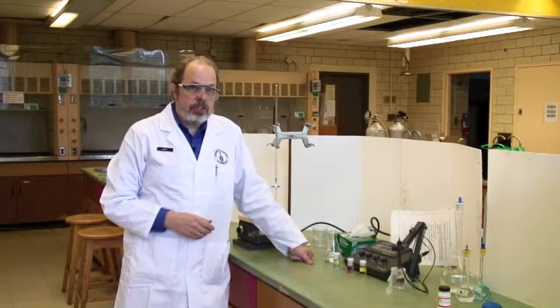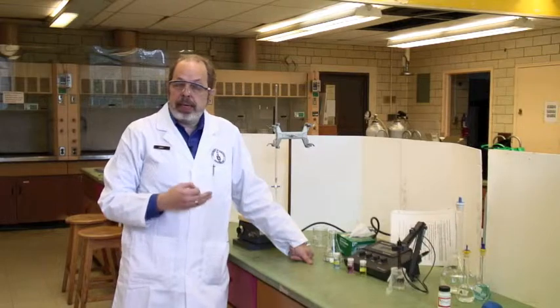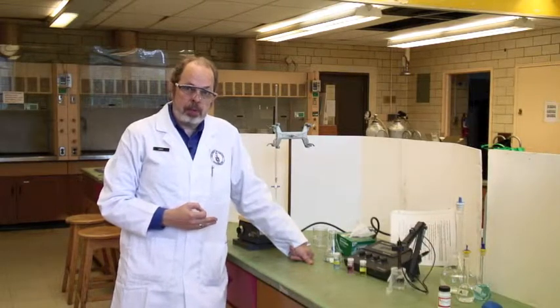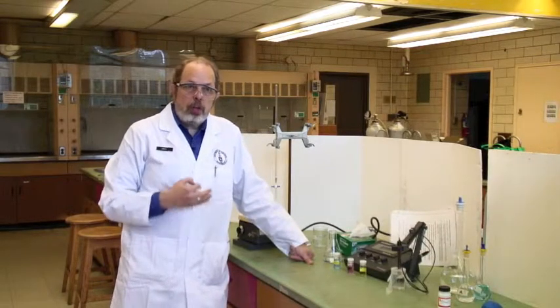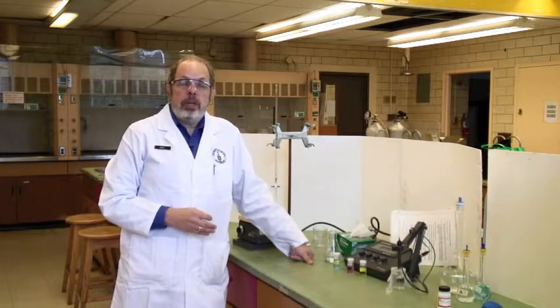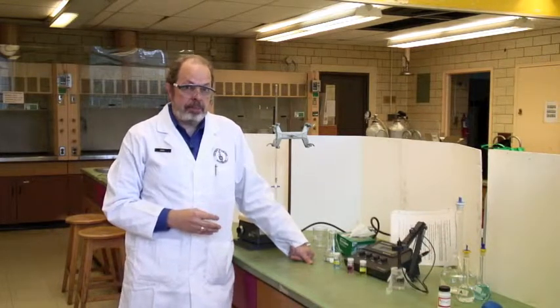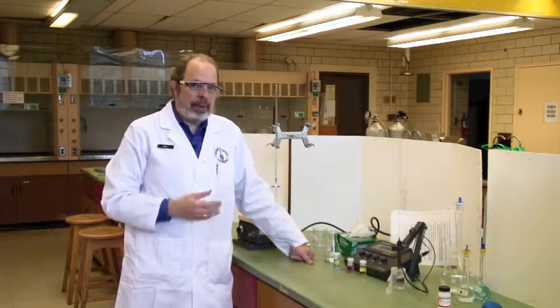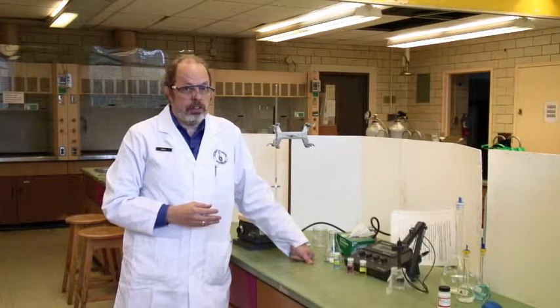This video demonstrates how to perform the chelating titration experiment, E1. You'll be monitoring this reaction using a pH meter, which is different from the standard indicator titrations you're used to.